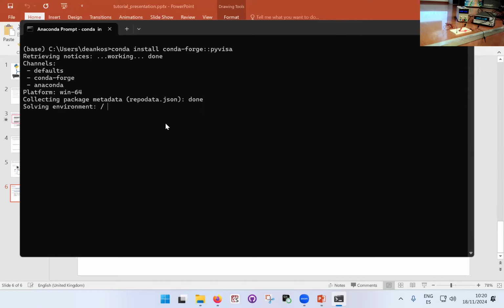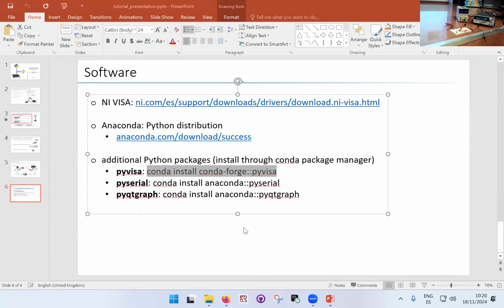So I will just close this. You see, it's sort of solving the environments. It's doing its own thing. It might take a few minutes for it to do everything it needs to do. But in this case, I'm just going to shut it because that's going to just take some time, and it's all already installed. Okay, so that's it for the slides.